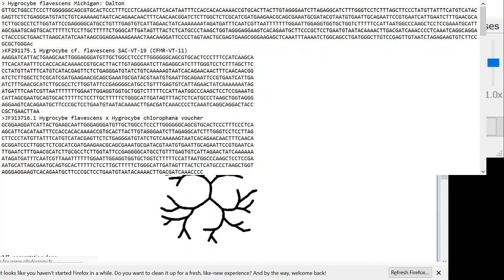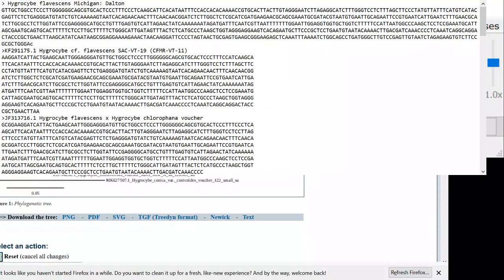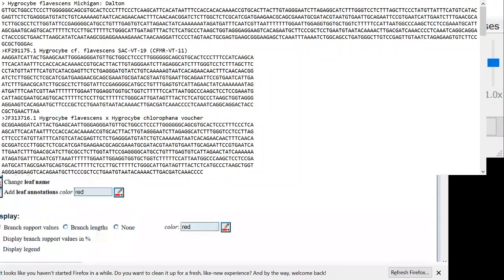But when you align all the sequences vertically, then you can directly compare each position, each base, and actually do a meaningful comparison. So here's my tree here. First thing I'm going to do is make it a little bit bigger.